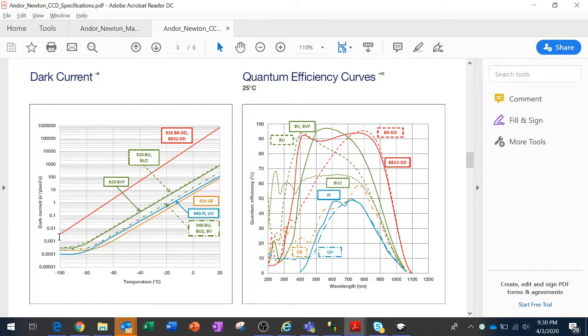It's a log scale, it's an Arrhenius process, so we're getting less and less of a jump each time, but we get a quieter background all the way down to -100. Of course, at that point, our expected value, our mean, and our variance for the dark current are all going to be much, much less than 1. So at small exposure times, a few seconds, we should have essentially no dark current, which is going to be great for a very sensitive measurement.